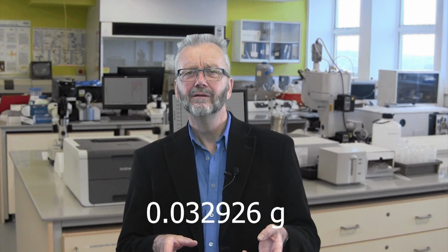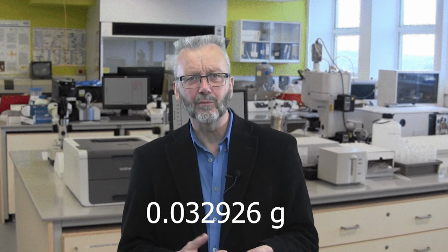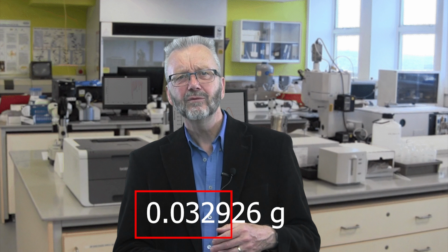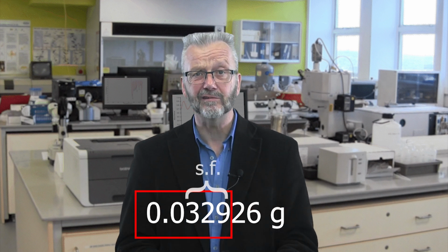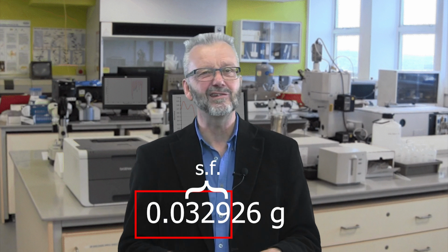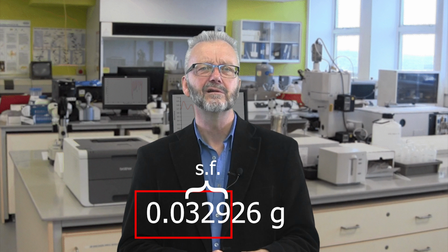Now at this point, we hit a problem. The mass we need to weigh out is rather small. A normal analytical balance weighs to 4 decimal places of a gram, which in our case means we will only be able to record 3 significant figures. This is okay for some experiments, but I want to work much more accurately than this.